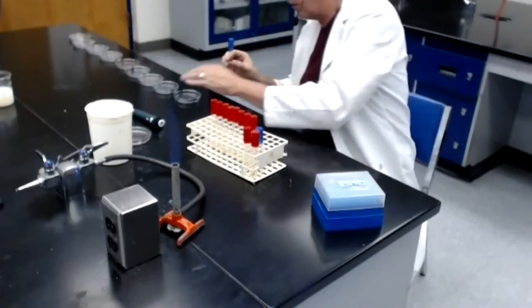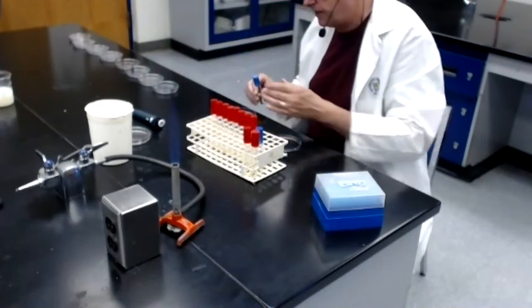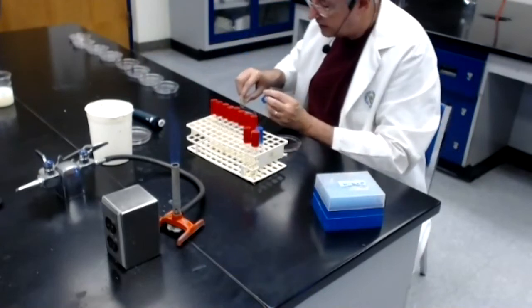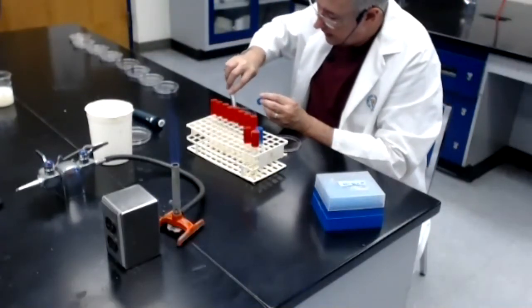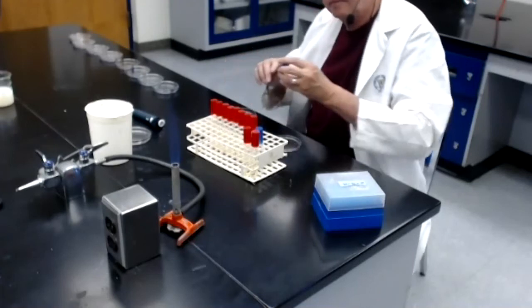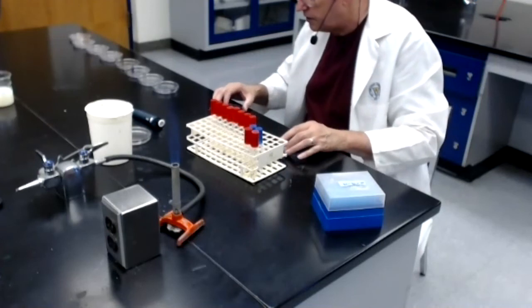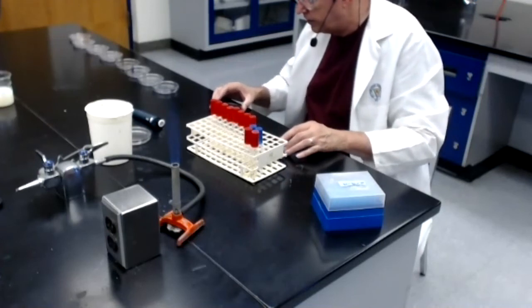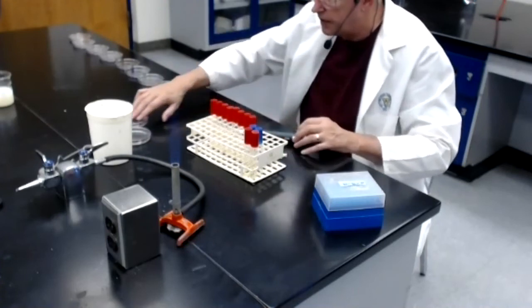And while it's still liquid, take plate number 2, which is labeled 1/100th dilution, and pour the entire contents of agar tube 2 into plate number 2. Tube back, top back on right away, and now swirl the contents of the plate to completely cover the bottom surface of the plate. And put it aside to harden.